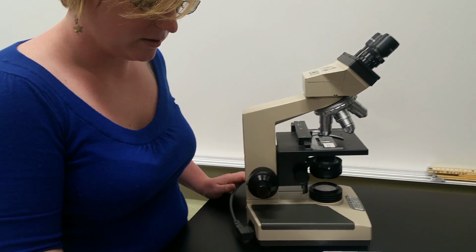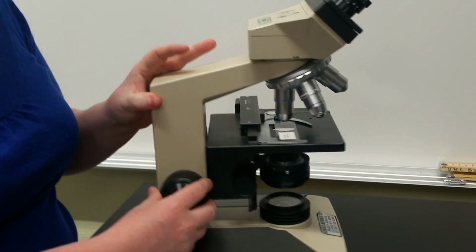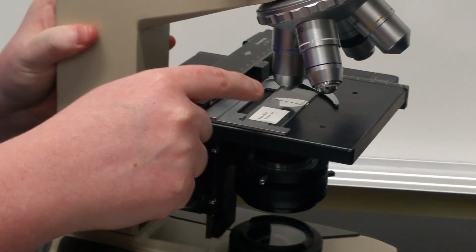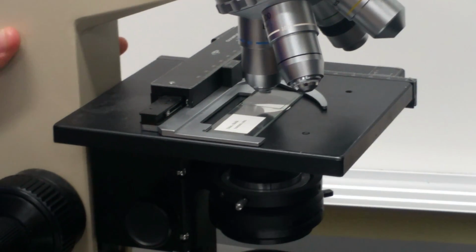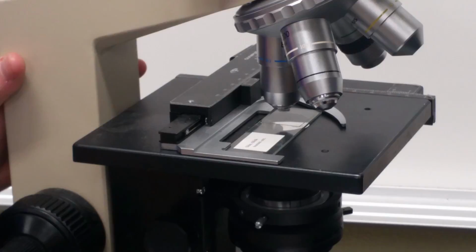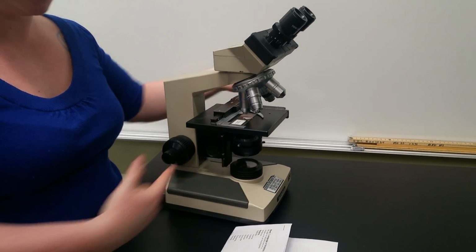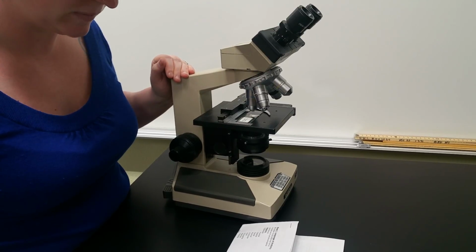Then we have the stage. The stage is where you're usually going to put your sample. So for example, on here, we actually have a slide on our stage. And I always think, if you're going to have something that you want to look at, like if a star is performing a song or whatever, you're going to put it on a stage, right? So put your sample on your stage. And that means you can look at it.